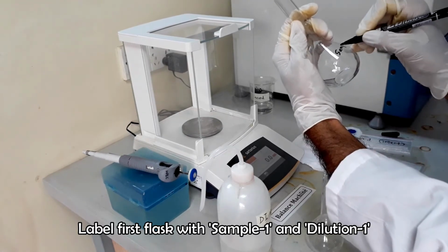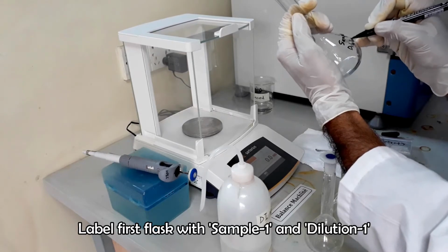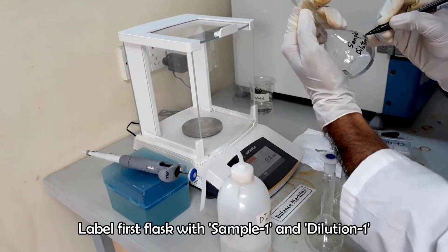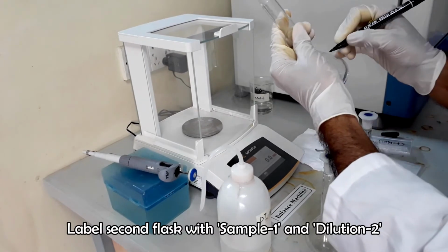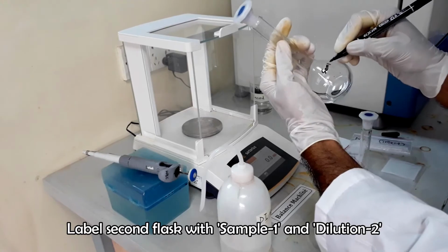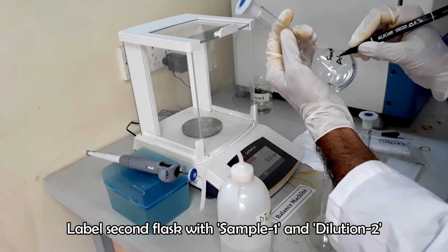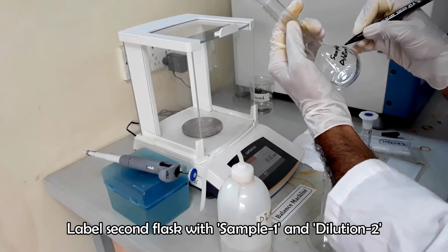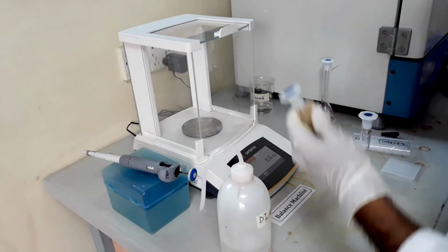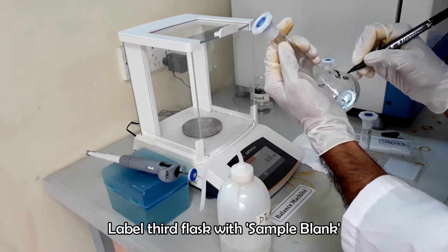Label first volumetric flask with sample 1 dilution 1. Label second flask with sample 1 dilution 2. And label third flask with sample blank.